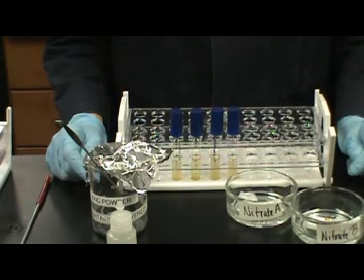Nitrogen is an important element for life, and many bacteria play key roles in the conversion and fixation of nitrogen into different forms for use by plants and other organisms. In addition to agricultural applications, nitrogen fixation or nitrate reduction can also take place in clinical applications, and the nitrate test is important in the classification and identification of many gram-negative and gram-positive organisms.